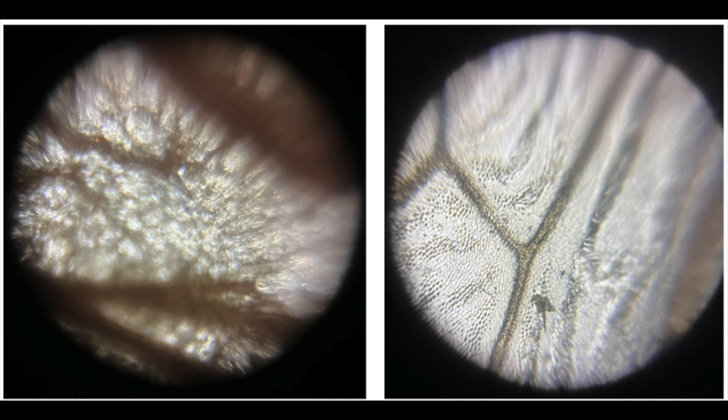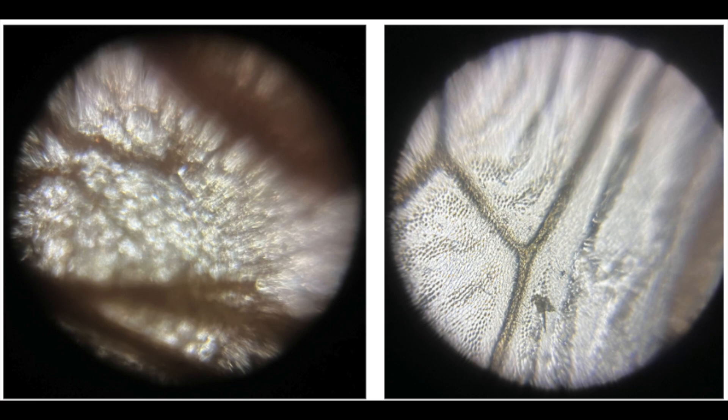The veins, blood, and wing cells of the crane flies are all transparent, which is why you can see these structures clearly under the Foldscope. Crane flies use their veins to pump insect blood through the wings to provide nutrients to the cells in the wing membrane and to cool the insect as it flies. Full veins increase the weight of the insect, so the number of veins in the wing membrane are minimized to make flight easier.